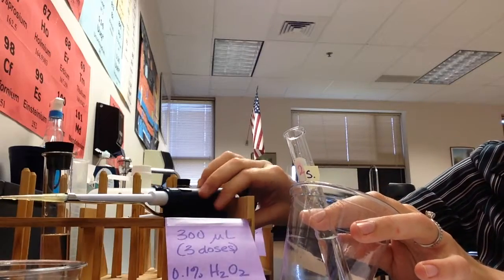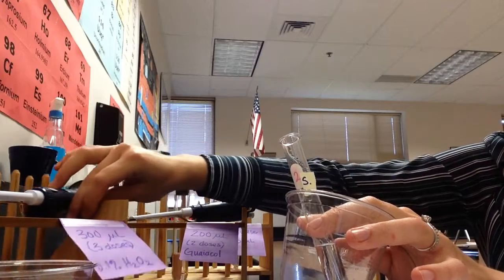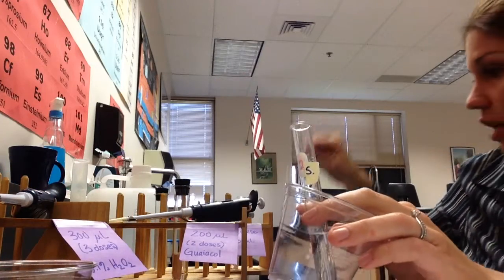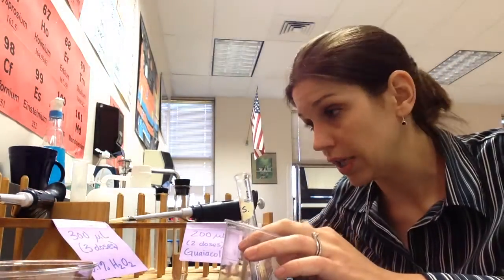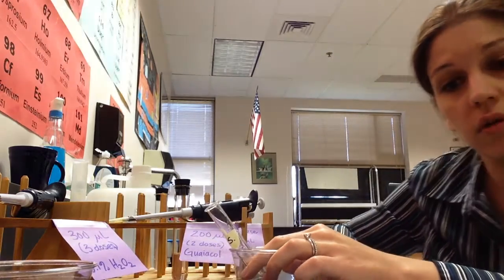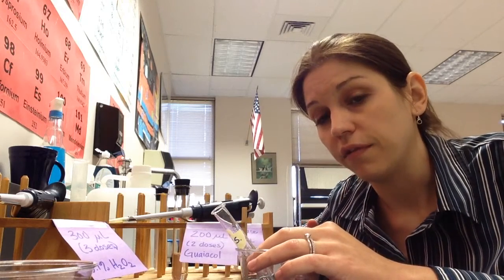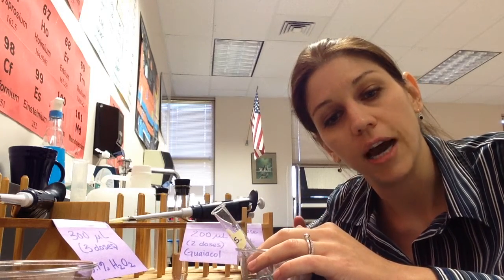Now, there's only going to be 5 spectrophotometers around the room, and so you don't want to start your reaction until you and your group has literally claimed one of them and you're standing in front of it, because you are going to keep record for 5 minutes of how these numbers are changing over time.